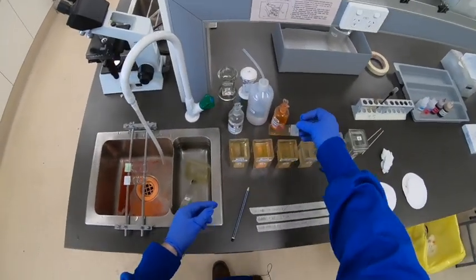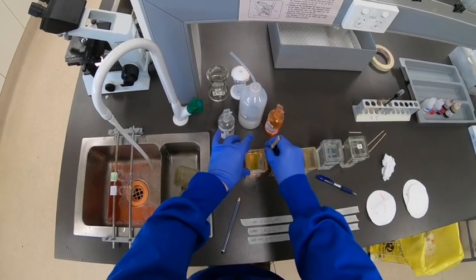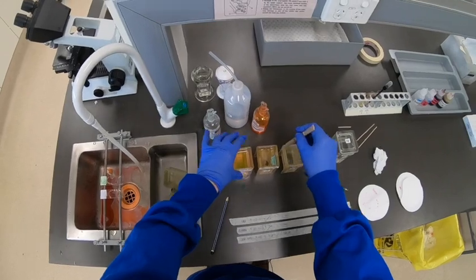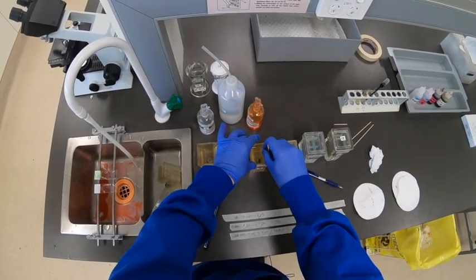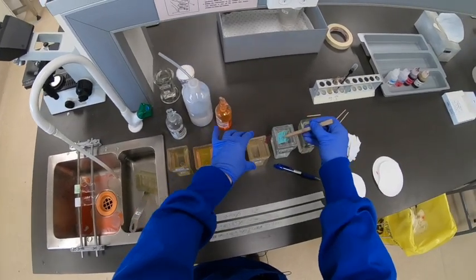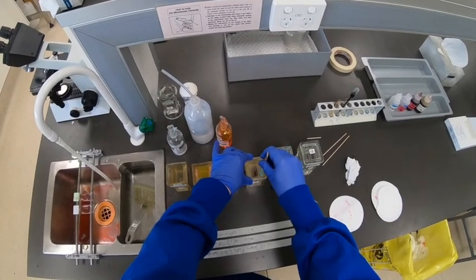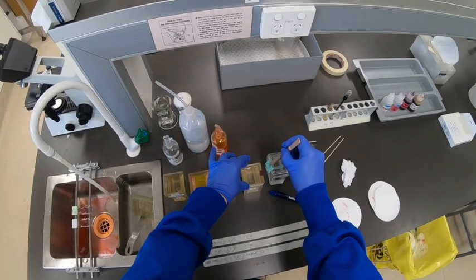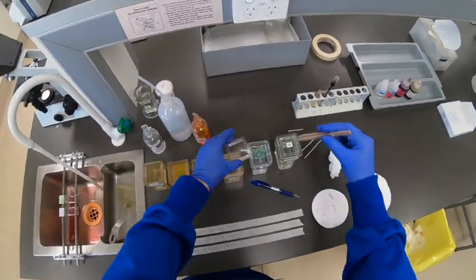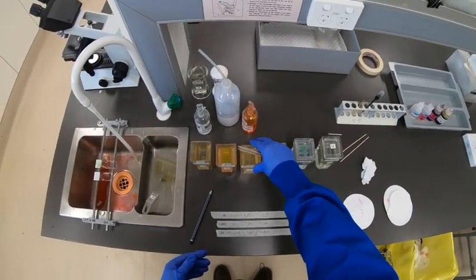Grab the last slide — straight to the 90%, sideways again. Now there's a bit of water coming back on the forceps, but that's okay, we'll get rid of that as we go through. Do also need to be careful not to bring too much alcohol over to the xylene, so giving it a bit of a tap is quite useful. So that's nicely rinsed — it's all done. They can sit in xylene for a minute or two and then subsequently be transferred to the other xylene for coverslipping.